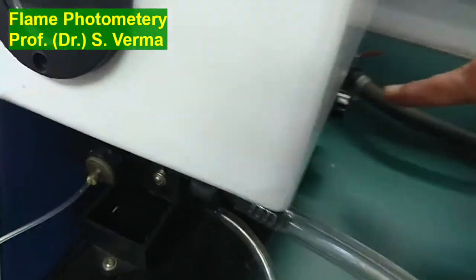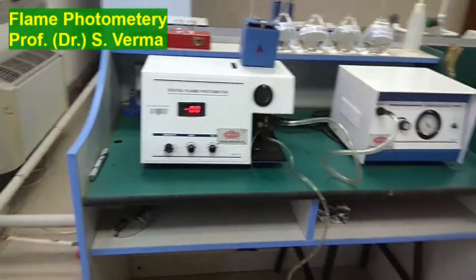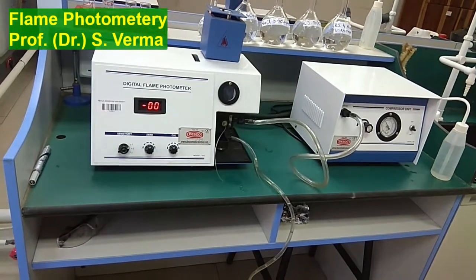In this particular instrument, this is the knob here, the gas knob. We are using LPG gas, but there are flame photometers which come with acetylene as well. That's not a matter of concern here. We have a flame photometer with an LPG unit.